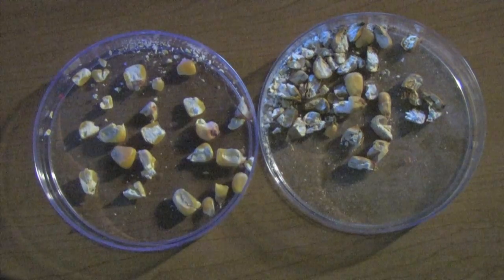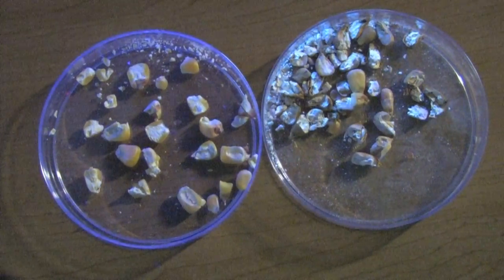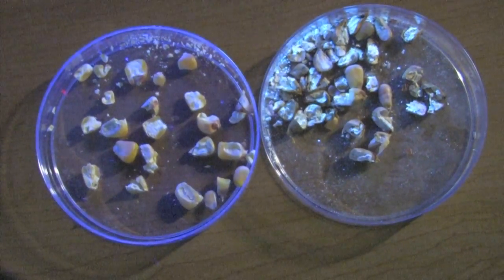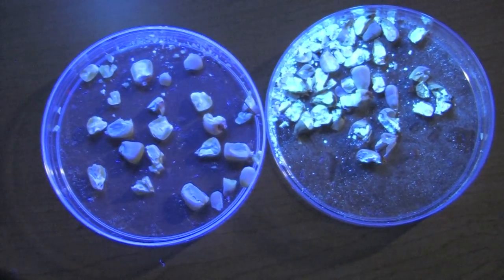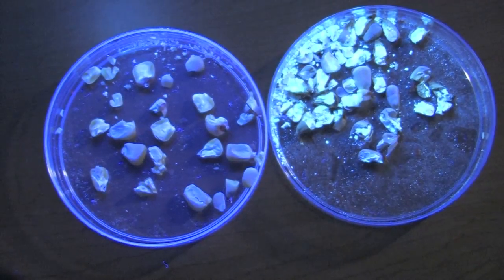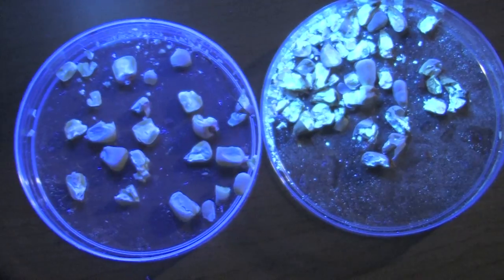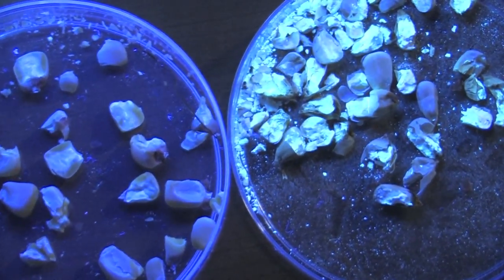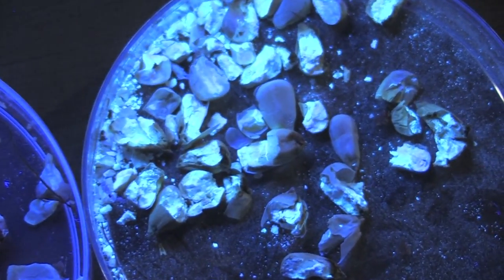Once you have the cracked corn, place it in a tray. Here we have clean corn and infected corn which has aflatoxin. If we expose it to the UV light, we can see the fluorescence in the contaminated grain. This grain here is quite contaminated, so we see a lot more fluorescence than you might typically see. The clean corn will have none.